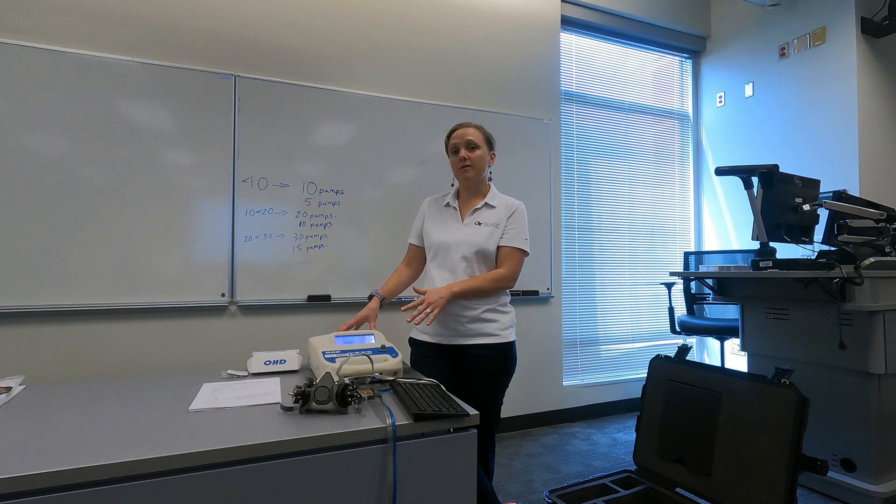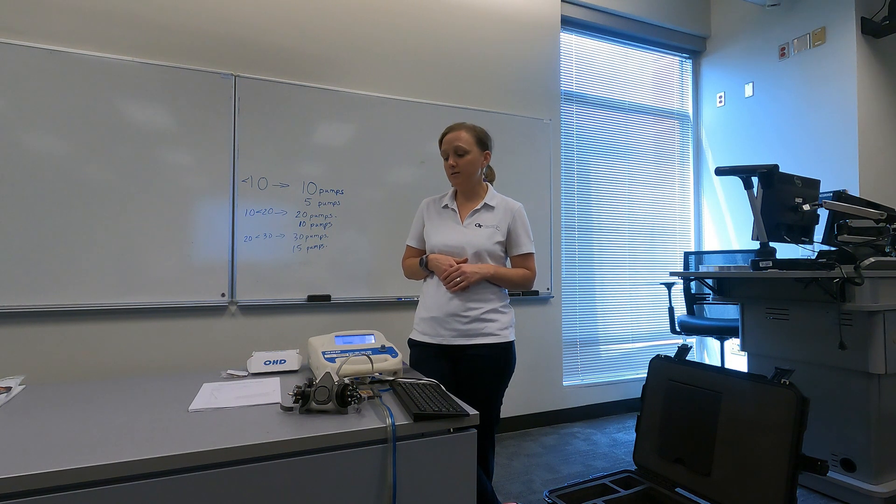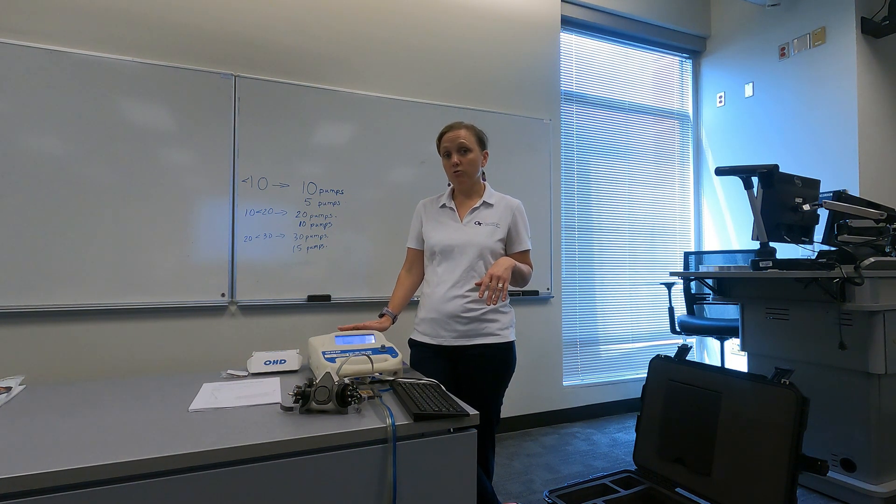Why would you want to use quantitative fit testing instead of qualitative fit testing? Qualitative fit testing is great because you can do it in pretty much any location, and the fit testing kits are relatively low cost. However, if you want an employee to wear a full-face tight-fitting respirator with an assigned protection factor of up to 50, or you want a digital record of the fit testing conducted, those are reasons why you might invest in or rent a quantitative fit testing machine. These machines are more expensive, but they do offer the advantage of creating digital records.